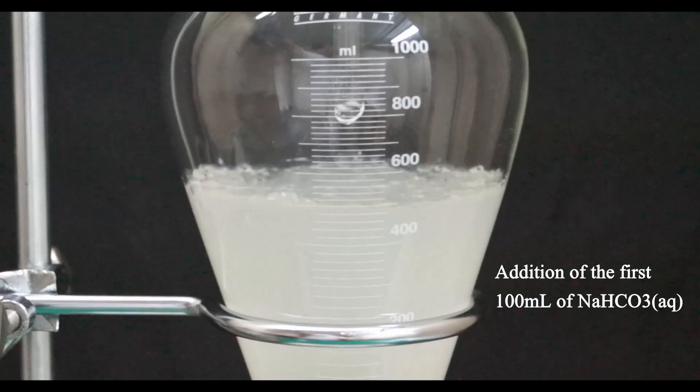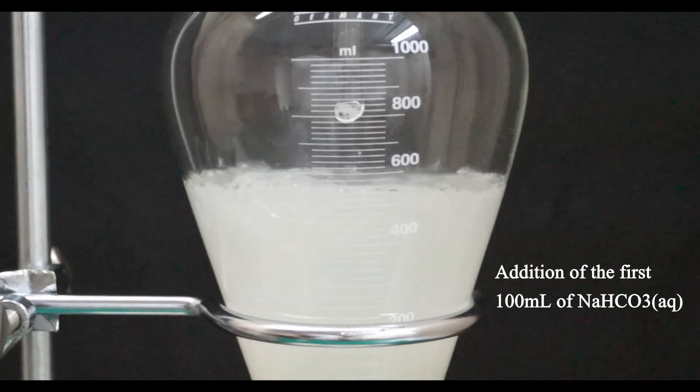When I add the first portion of the sodium bicarbonate solution we see a lovely and vigorous evolution of gas. This gas is carbon dioxide and it is being formed by the reaction between the sodium bicarbonate and the dissolved hydrogen chloride gas.